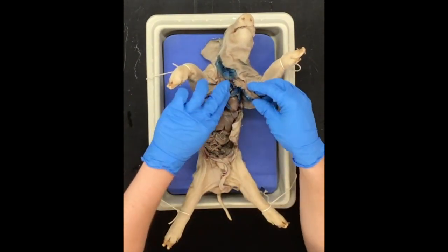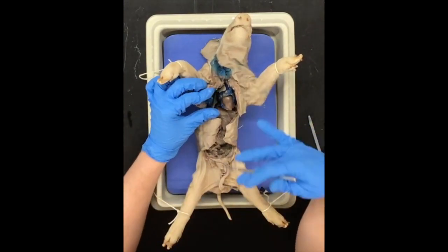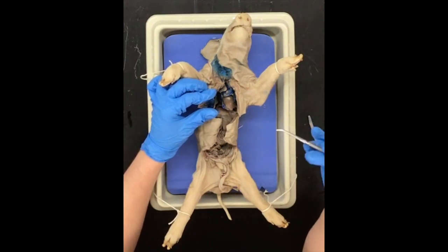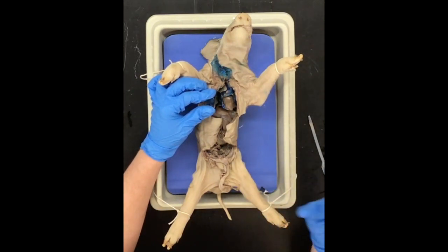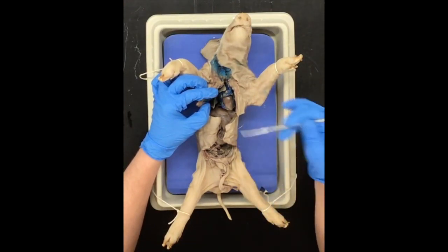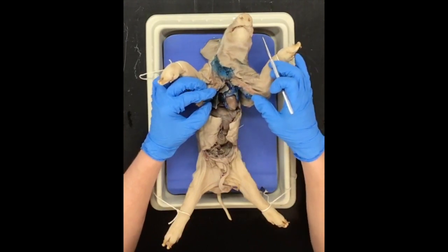I wanted to pause real quick just to make a quick distinction. You might notice there's some blue substance here, and also a little bit of red substance. This is not naturally part of the pig's body. A lot of people have the misconception that our blood is blue and then becomes red when it leaves the body — this actually isn't true. It's more of a dark maroon before it's oxygenated, and then when it gets oxygen it becomes a more bright red. The reason it's blue inside here is because when the pig dies, they drain the blood and inject it with this artificial dye to help us visualize blood vessels more clearly.